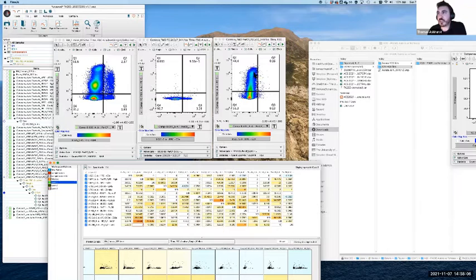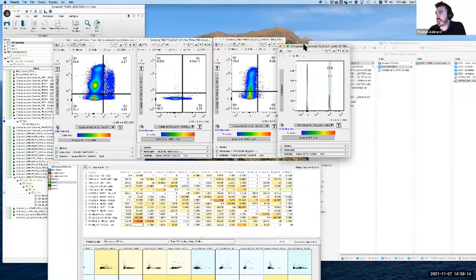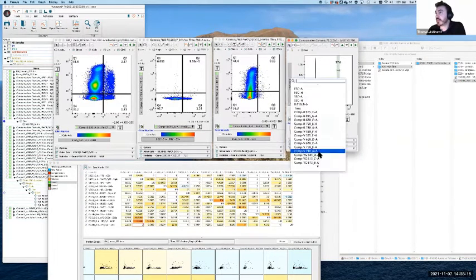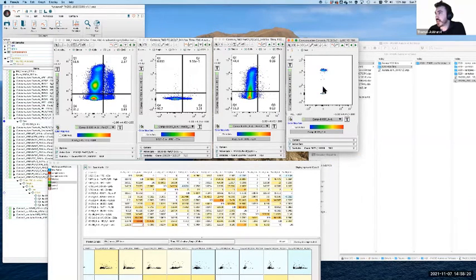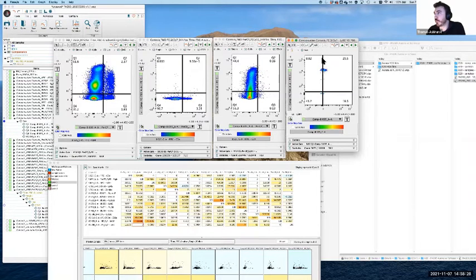Now that actually looks not too bad, but it's probably not quite right. It probably actually does require a little bit of compensation. If we bring up the single stain and we do the same, what we'll hopefully see is that, yeah, it does. If you line these two up a little bit, what we're looking for is to get the median of this group in line with the median of this group. And yeah, actually, it does need to come over a little bit.